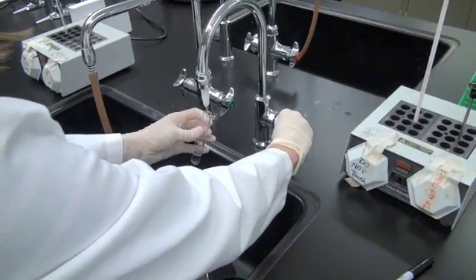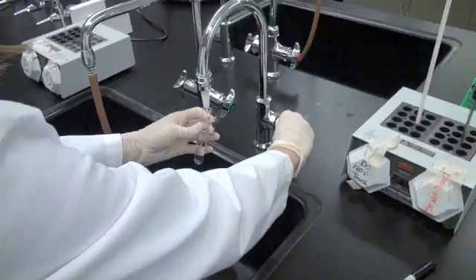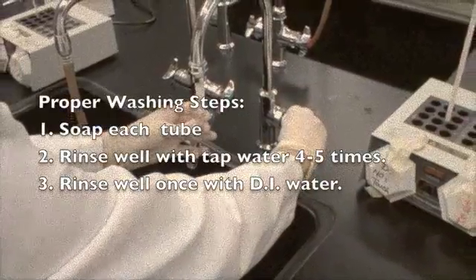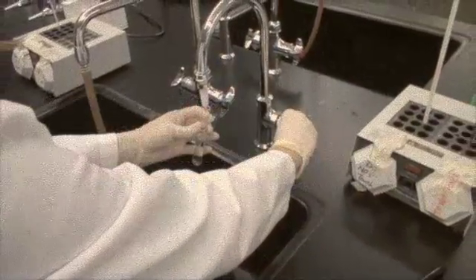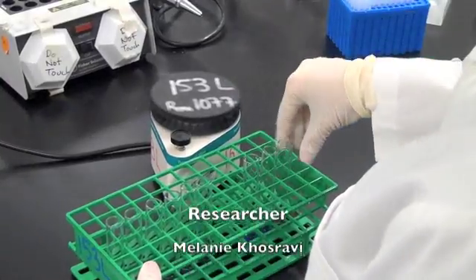Lastly, wash your tubes out well with soap and ample rinsing. Washing your tubes for reuse is extremely important, as any residual dye can adversely interfere with future assays.